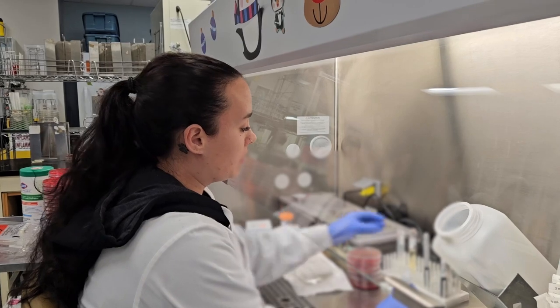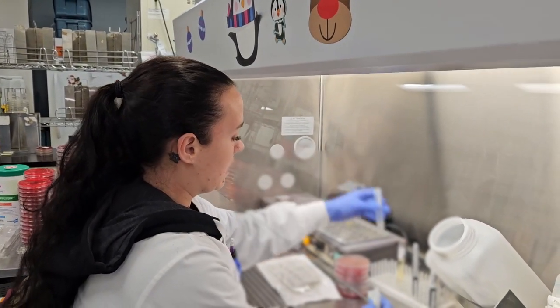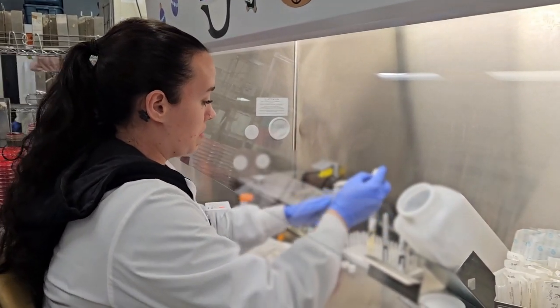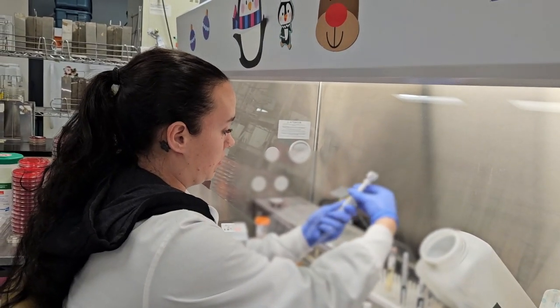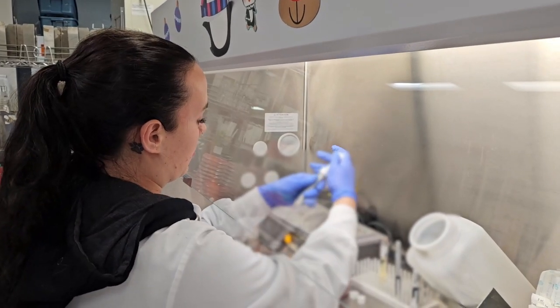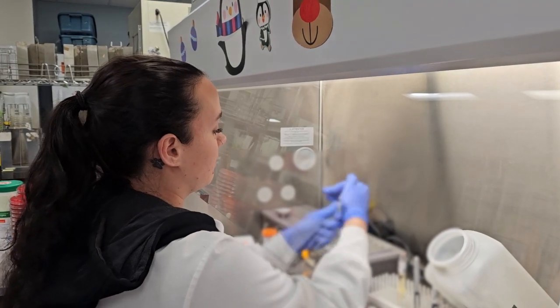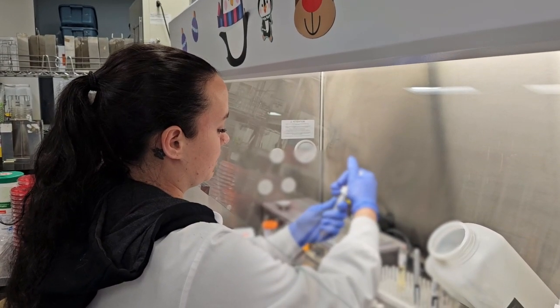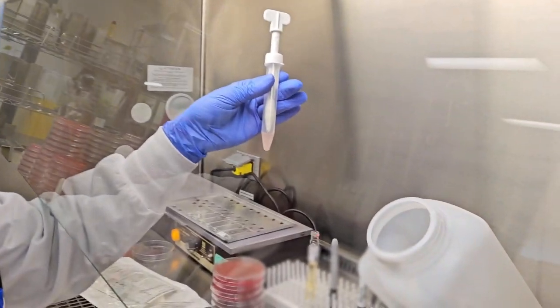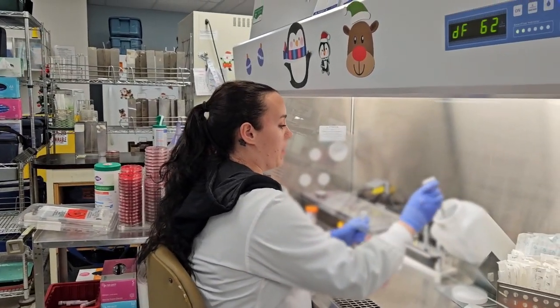We'd use saline with our tissue grinder, just like that. And I'm going to carefully take out the tissue grinder itself and place it in the conical tube here. I'm going to make sure it's nice and secure, and then I'm going to grind up my tissue. You can see that my tissue has now been ground up. I now no longer need this. This will go in our biohazardous container.